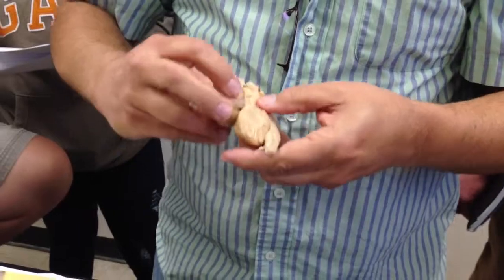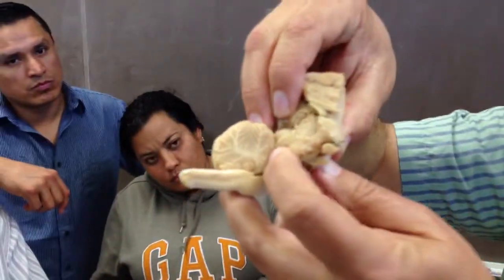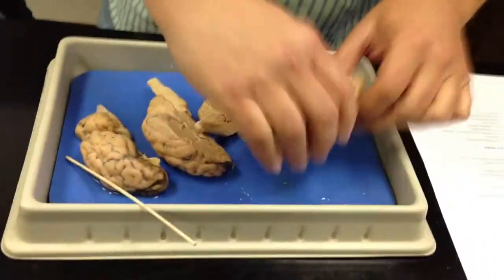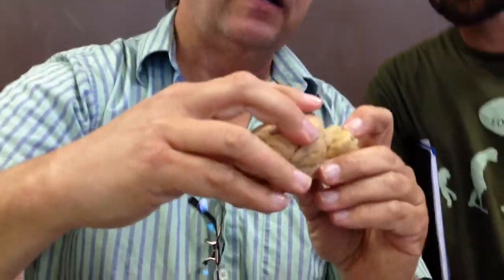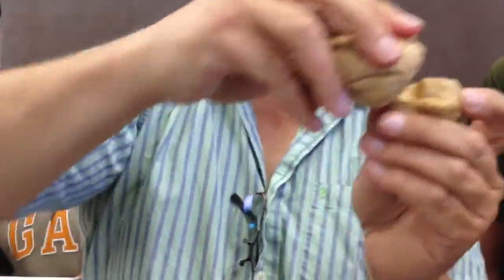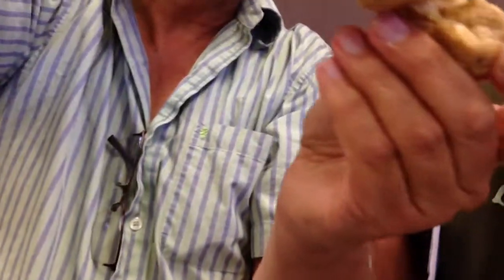The mesencephalon has one really distinct structure that you could see. You see those little bumps on top of it? Right there. Those little bumps, that's the corpora quadrigemina. I think this is something that you can actually see better on the whole brain. If I pull back the cerebellum, now you can see there's actually 4 little bumps in there, 2 small ones on the bottom and 2 larger ones on the top. So corpora quadrigemina, there's 4 of them.